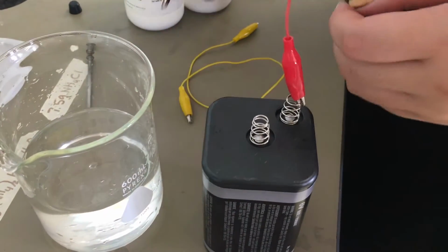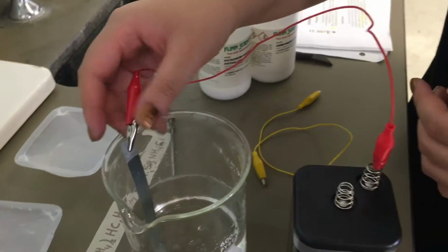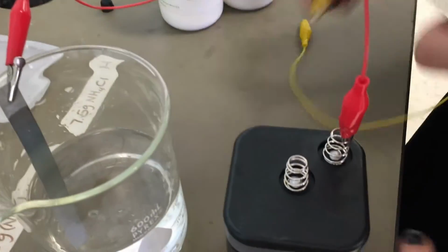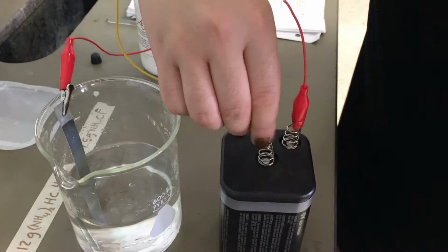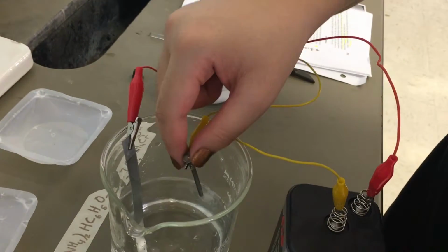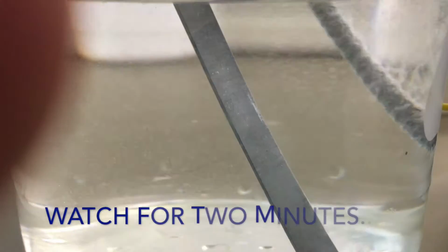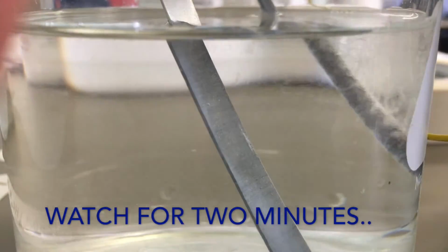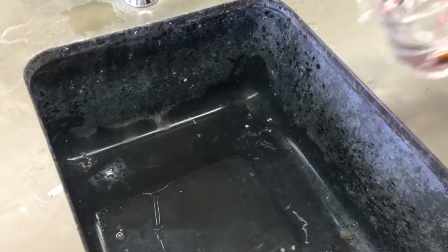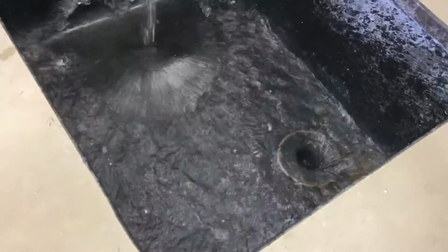Using alligator clips, the zinc strip was connected to the positive end of a 6-volt battery and the iron nail was connected to the negative end. Both the zinc strip and the nail were placed into the solution for about 2 minutes without touching each other. After the experiment, the solution was poured down the drain with the water running.